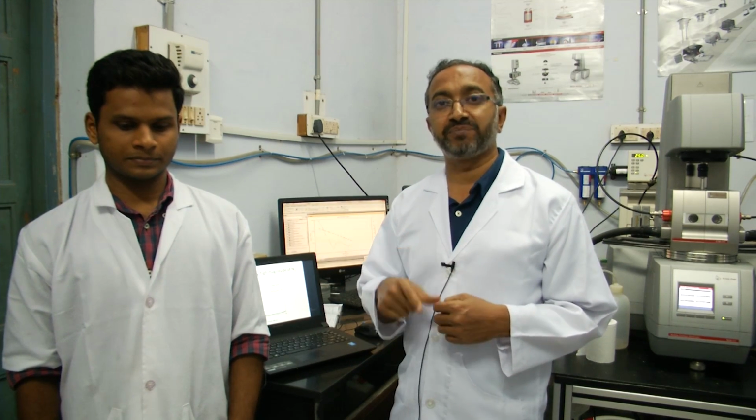From now, what we will see is, in case we need to examine the material microstructure along with its rheology, what kind of a tool we can use, and specifically we will look at doing microscopy along with shearing. So there are many additional attachments available with a rheometer to have some additional information about the material as we do the rheology of it, like if it is a steady shear or if it is an oscillatory shear. In all these cases, what is really happening to the material we don't know. So if you use an additional attachment like a microscope, we can find what is really happening to the material when we shear it.